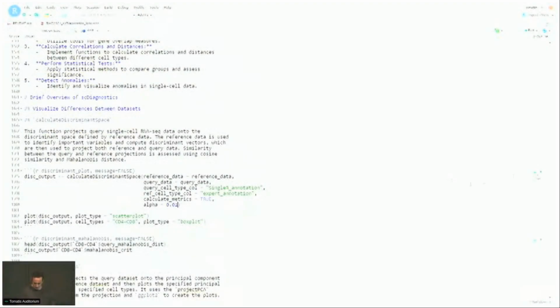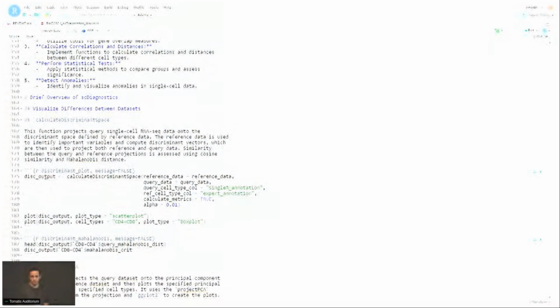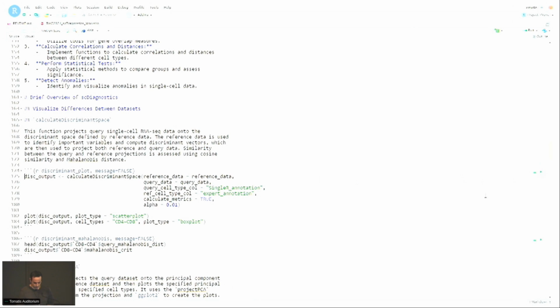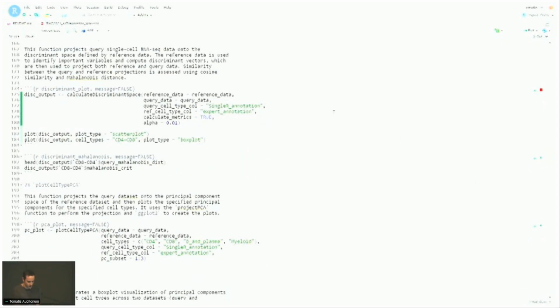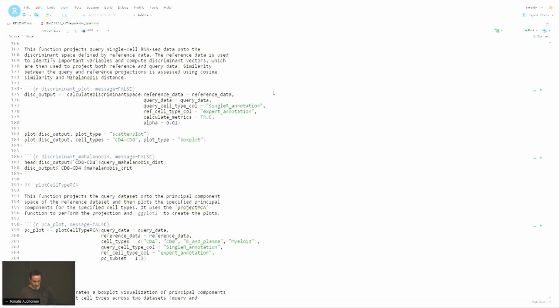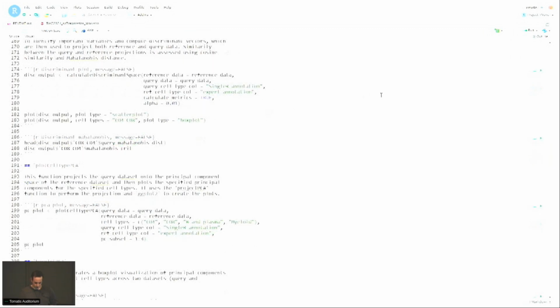Okay, that just finished. So now we can run this function. Most functions have an S3 plot method as well, which allows you to just plot the object that's returned. But to Lambda's question, everything that is used to produce the plot is included in the return value of the function, and much more. So if I just run this, for example, hopefully it doesn't take too long. It was pretty quick on my computer. Yeah, if you run it on your computer, it's going to be instant. Not sure why it's not producing. Oh, there we go.